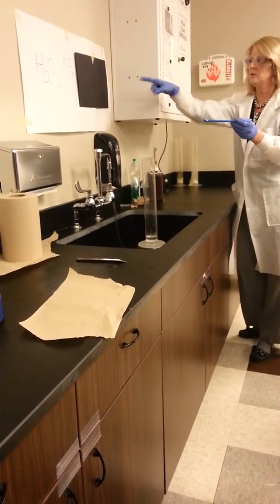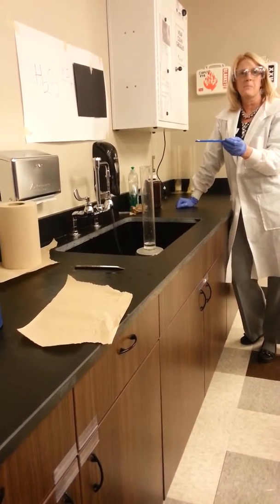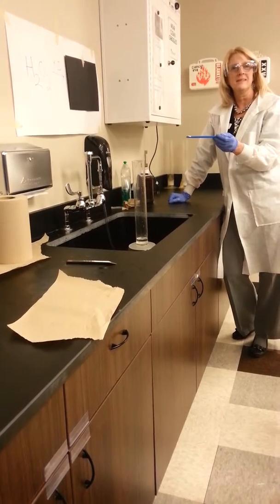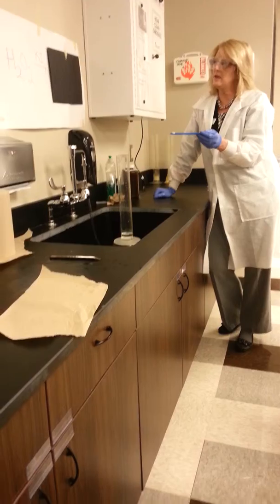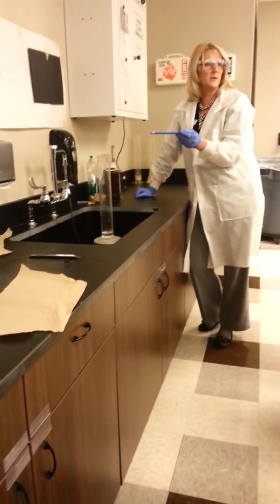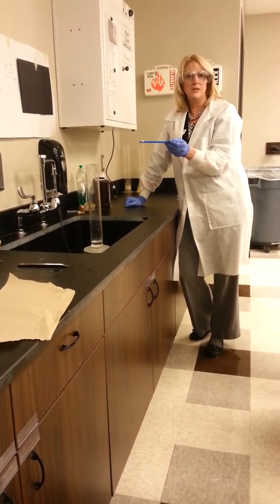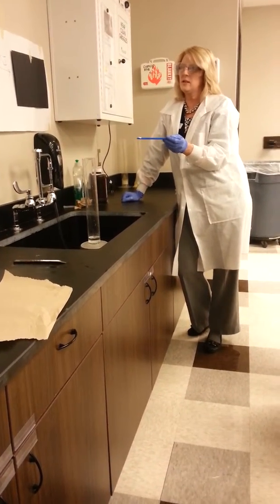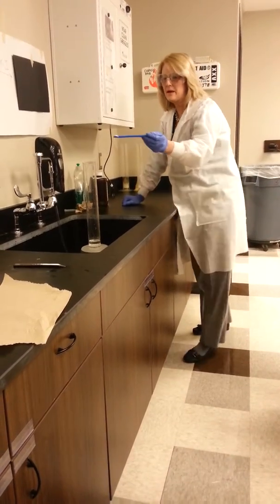Okay, can you guys predict what your products should be from this reaction? H2. I'm hearing what? Water and oxygen? That would be a possibility. What's our other possibility? Hydrogen and oxygen. Okay. And what type of reaction is it? Decomposition. So let's see what we get.